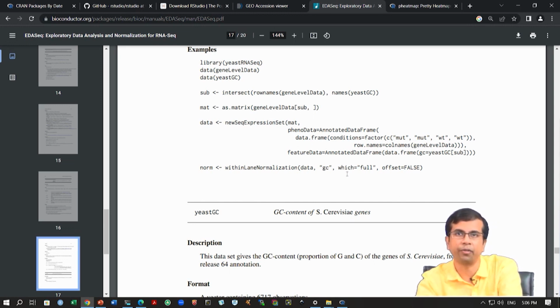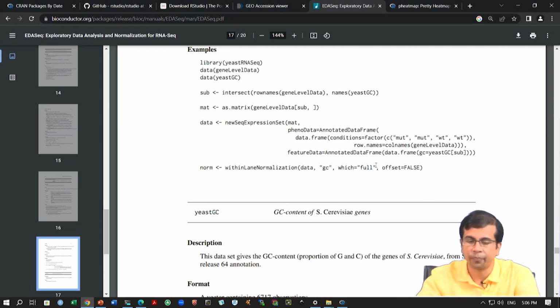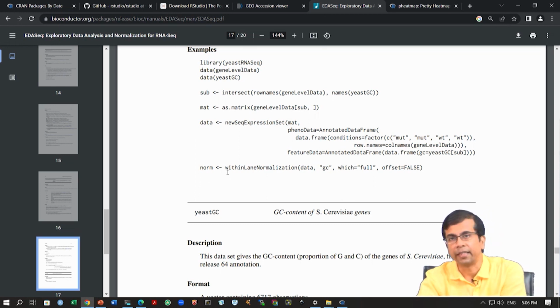Okay. So, the next step is to actually run this within lane normalization, and then use a specific type of method. We can use loess method, we can use full quantile normalization, right. And then, so there are 3 methods that are mentioned. So, we can use any of the 3. Again, these options are given on top, and you can find them, and then the normalized data will be created. Okay, and we can then export that normalized data into a text file. Okay, so let us do that now.